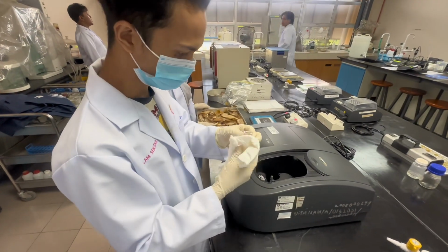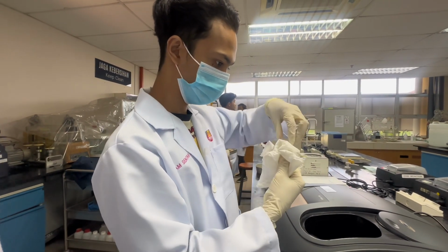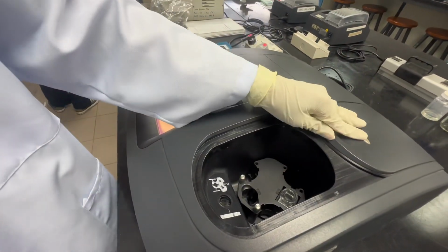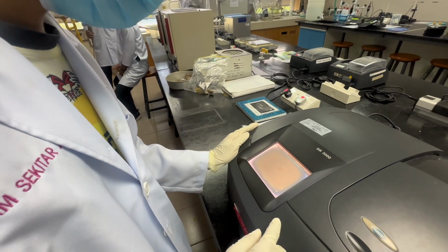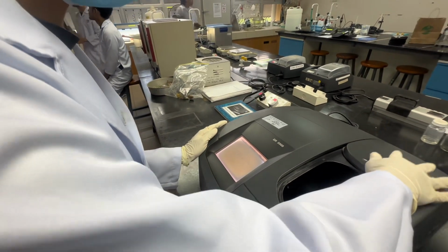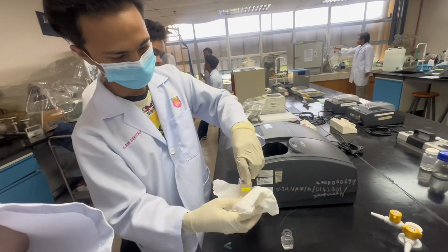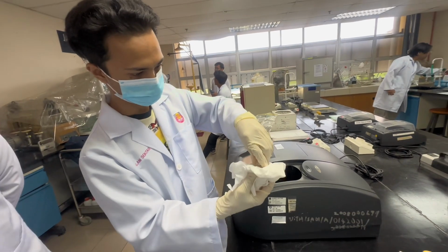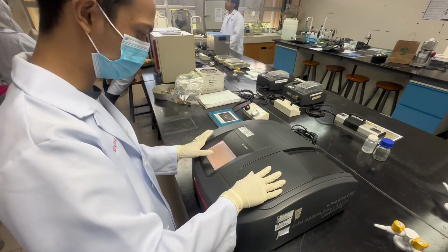Before we put in the spectrophotometer, the blank sample is inserted into the spectrophotometer and then set to 120 for color measurement code. And then click the zero button. Take out the blank sample cell and put the raw water sample cell into the spectrophotometer, followed by clicking the read button. And then record the data that we have obtained.